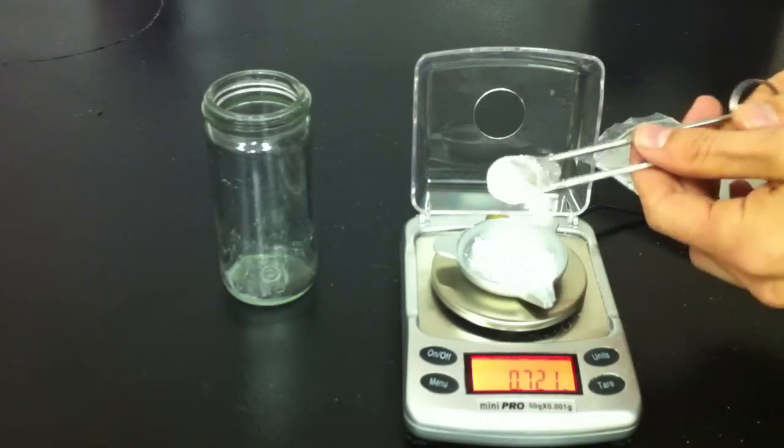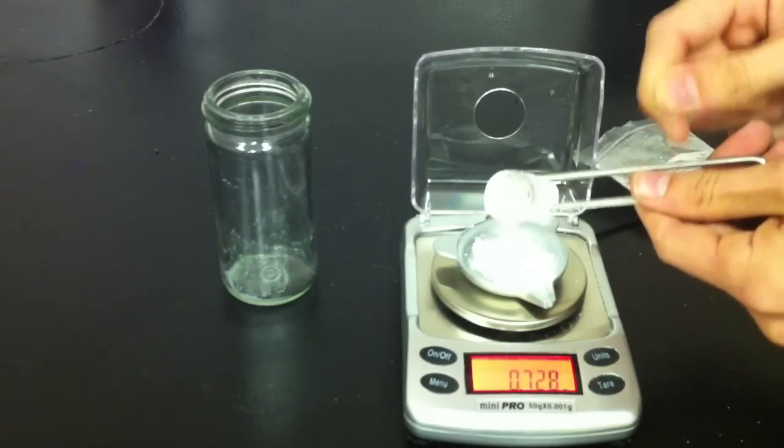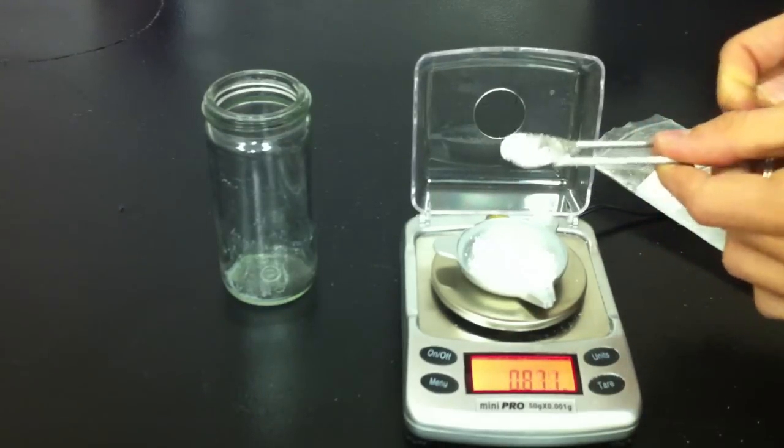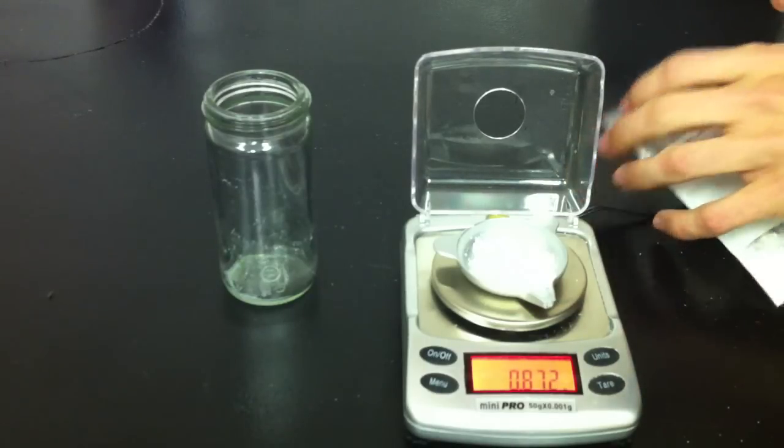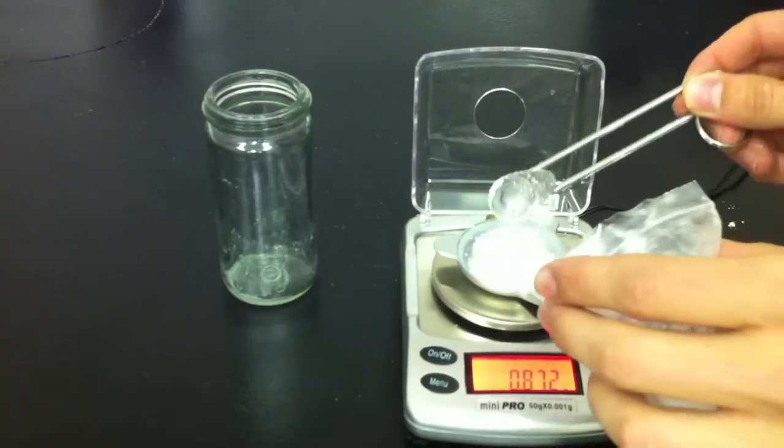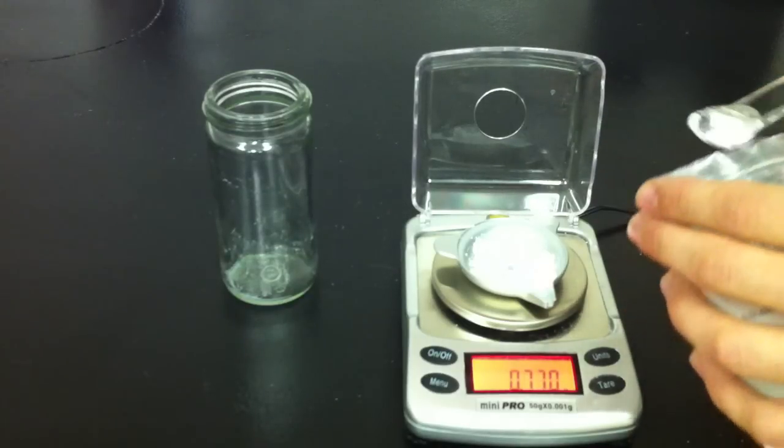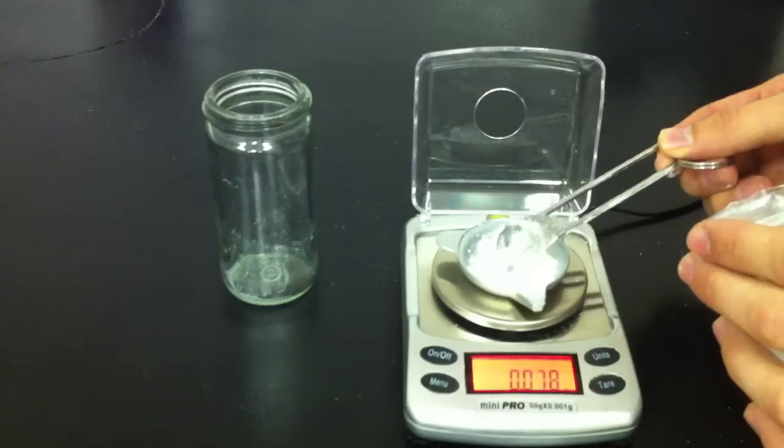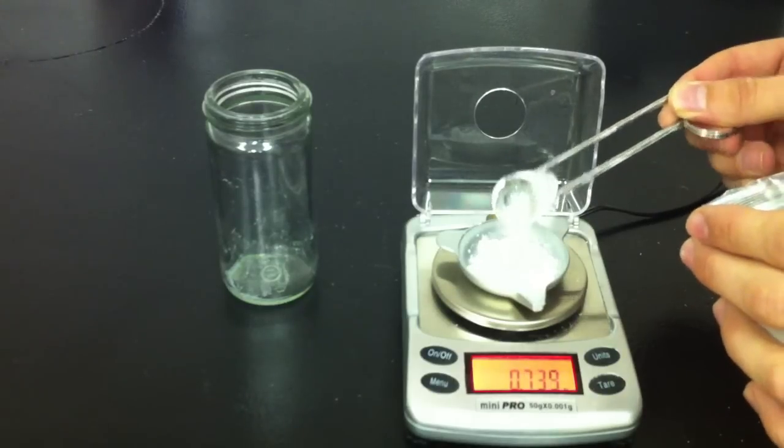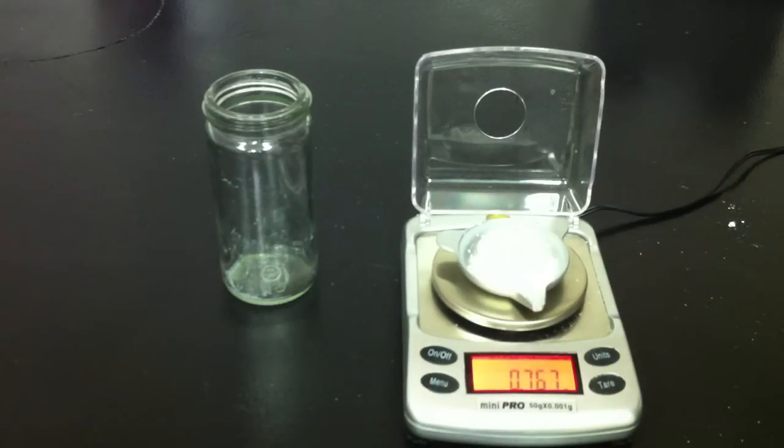This is going to be difficult here. Of course I can always go on the high side. So I'll go ahead and go with the, oh no that went to 8. So now we've weighed out 767 milligrams RU. That's close enough for my target.